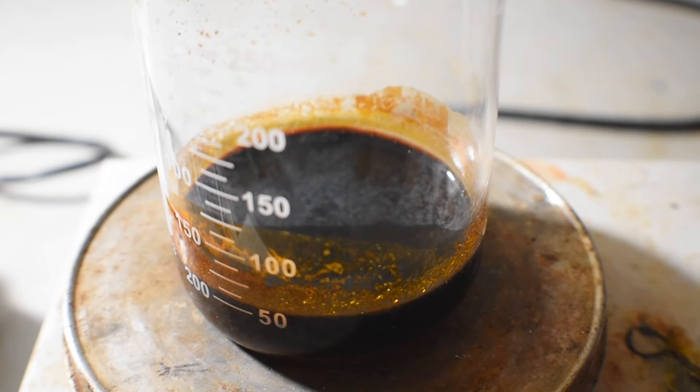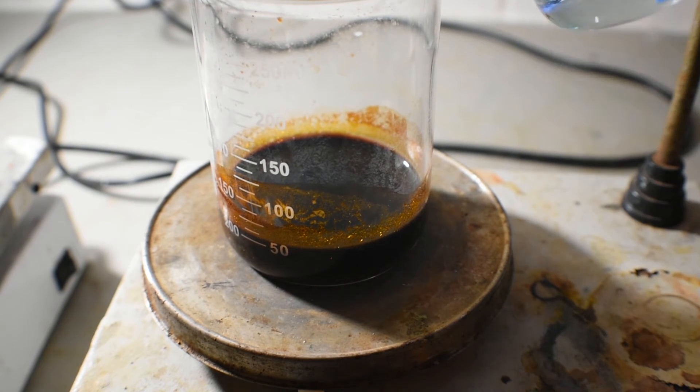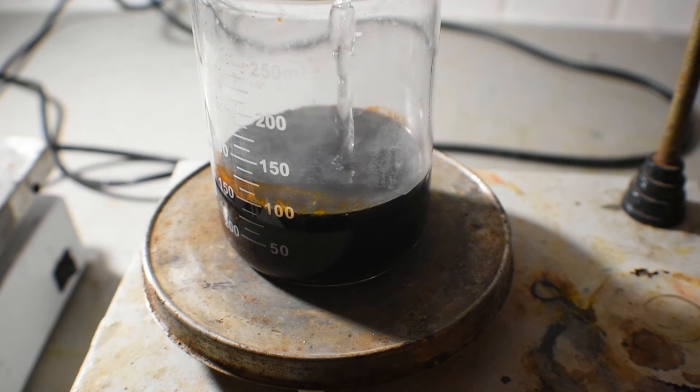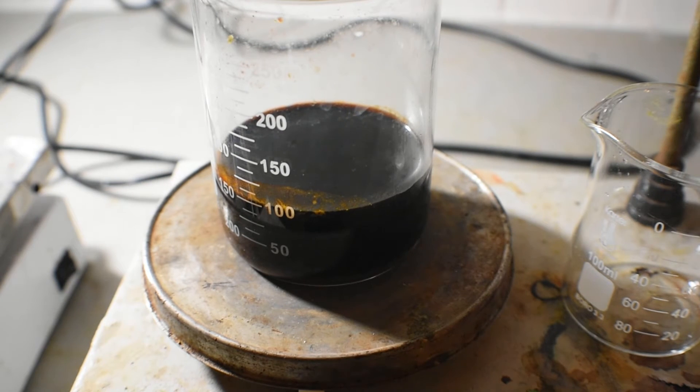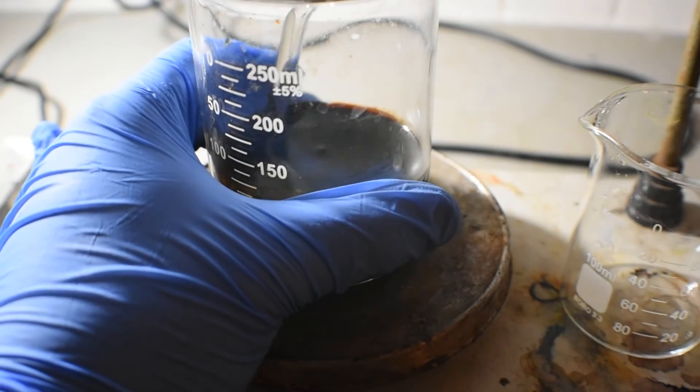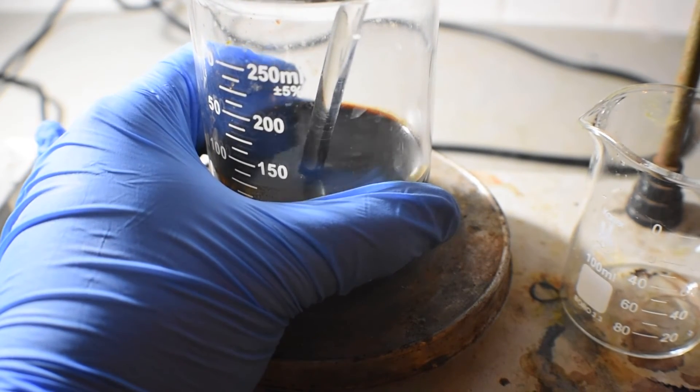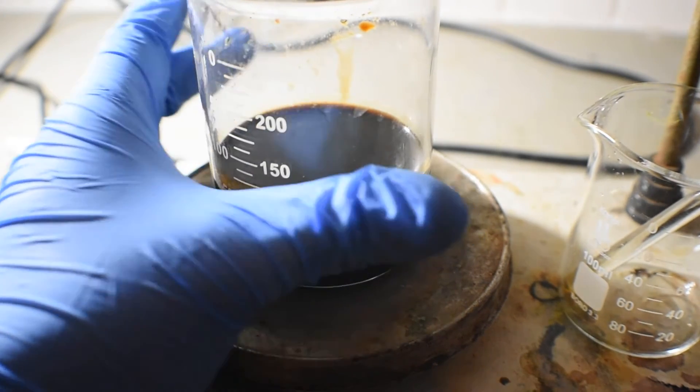Initially, I will need more eventually to wash away all of the residual hydrochloric acid, as I do believe that decomposes the product on drying. First up, the hydrochloric acid. Now it doesn't seem like it's going to want to stir, so let me give it some help. There we go.